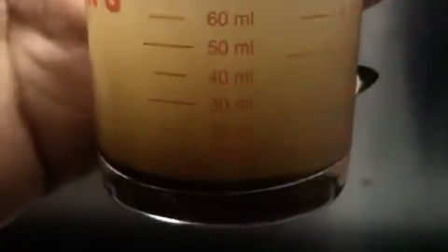So from the observation of the soil sediments inside the graduated cylinder, it looks about 3, maybe 2 milliliters has settled. So now we'll move on from the tilled field soil sediment to the wooded area soil sediment.